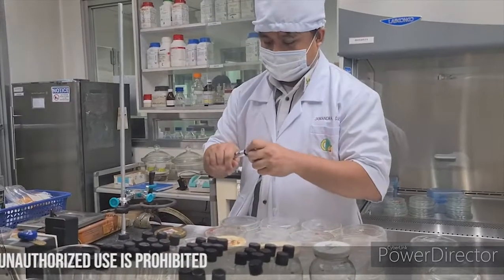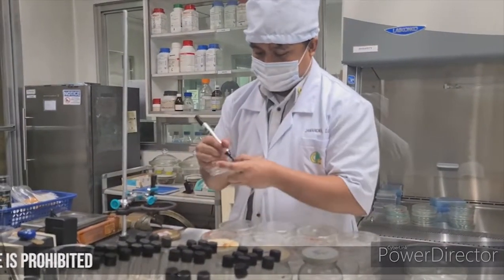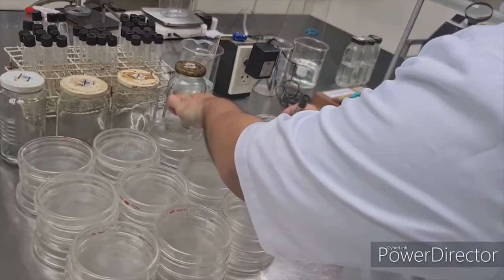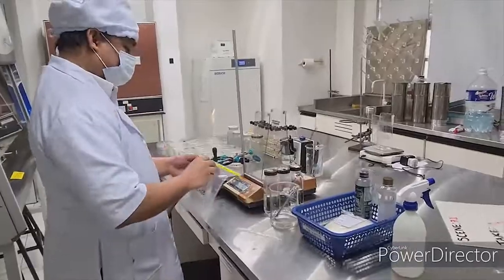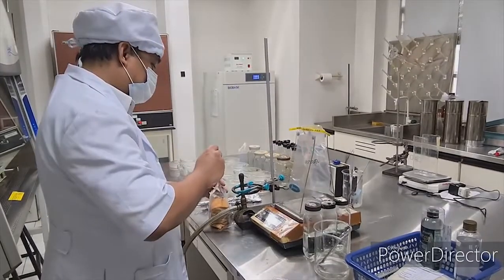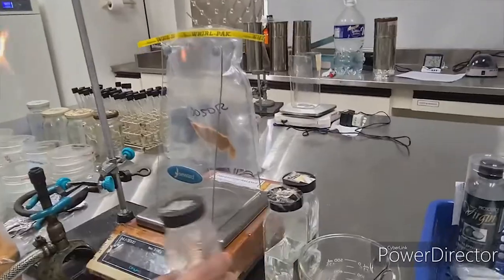Prior to the analysis, sterile plates and tubes are arranged on the table and are properly labeled. At the start of the analysis, the sample is weighed and diluted. It is then homogenized using the stomacher.